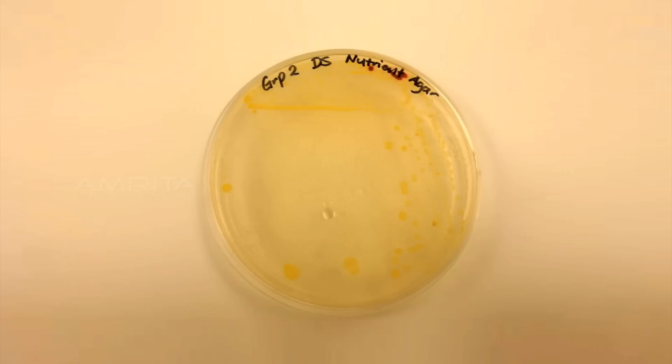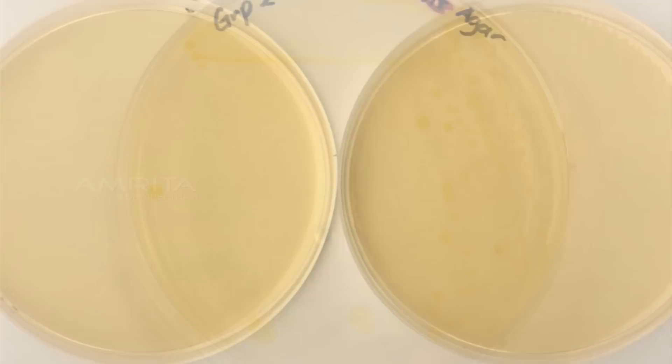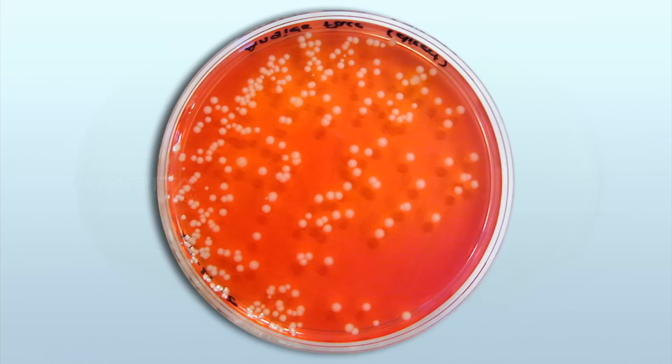Preparation of Selective and Differential Media. A culture medium is a solid or liquid preparation used to grow, transport, and store microorganisms. To be effective, the medium must contain all the nutrients the microorganisms require for growth.